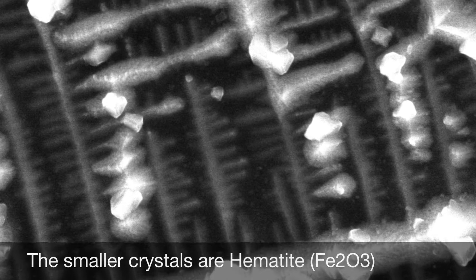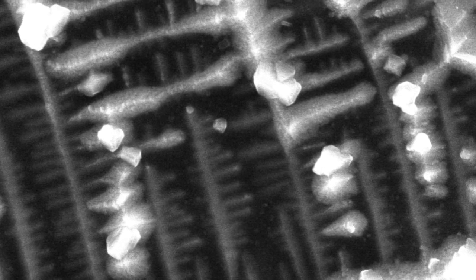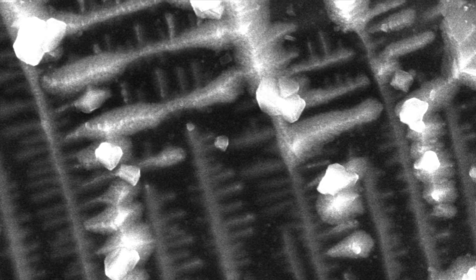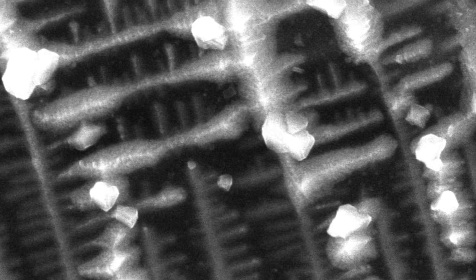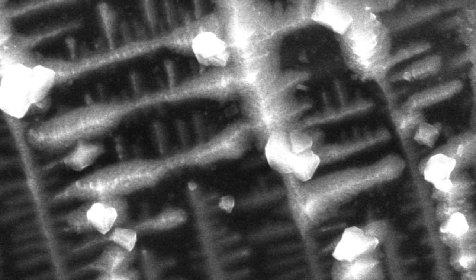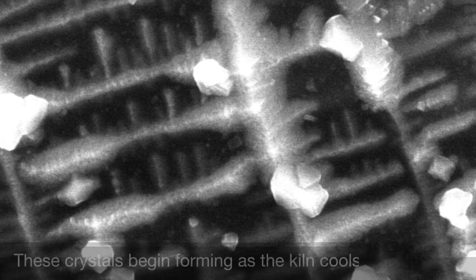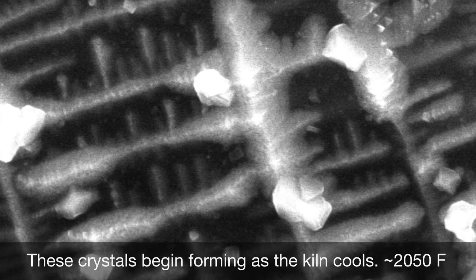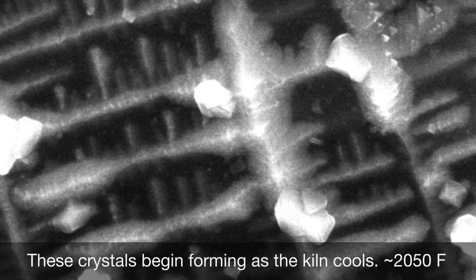And it's much easier for a crystal to grow on the side of another crystal than it is for a crystal to grow all by itself in the middle. And so that's what is going on with all these branch-like structures. The iron is falling out of solution and it's crystallizing in the easiest place that it can.